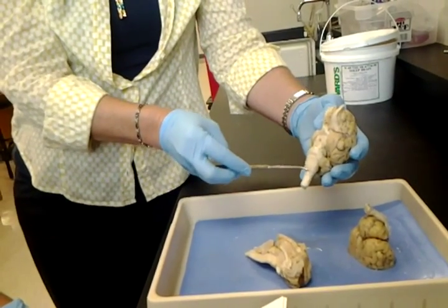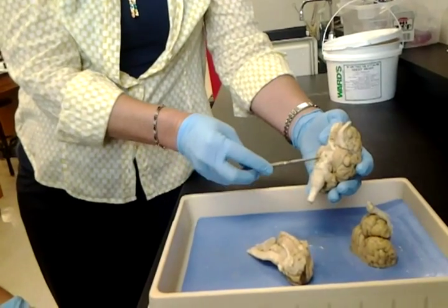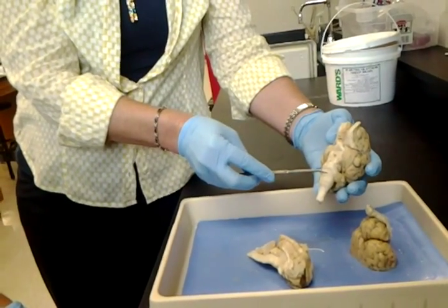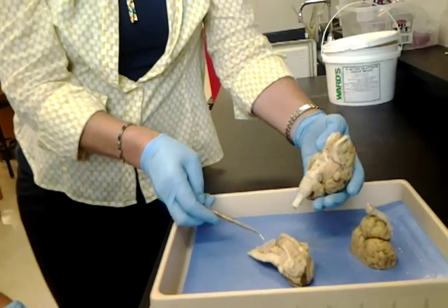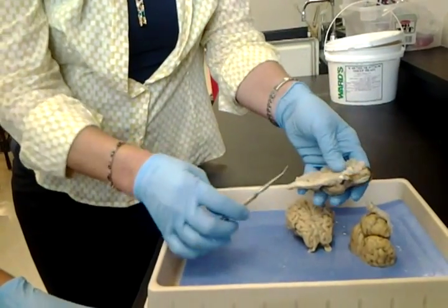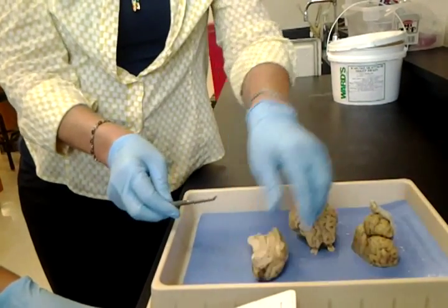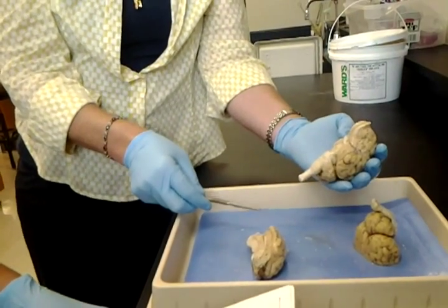Notice the sheep brain medulla is really large. Not so big on the human models. So pons is the top of the P, medulla, spinal cord. If we did a longitudinal section, most of this is medulla. It's not really very clear there, so I usually label it this way.